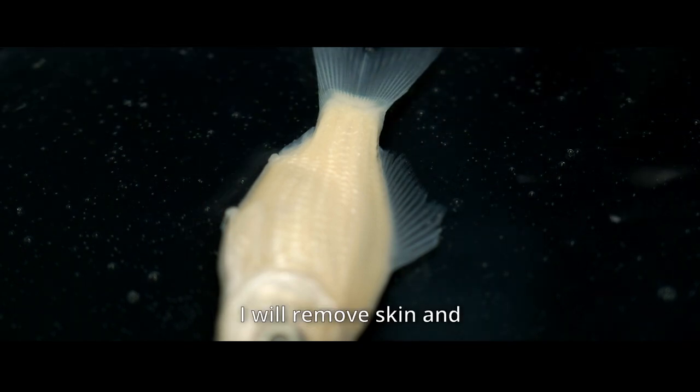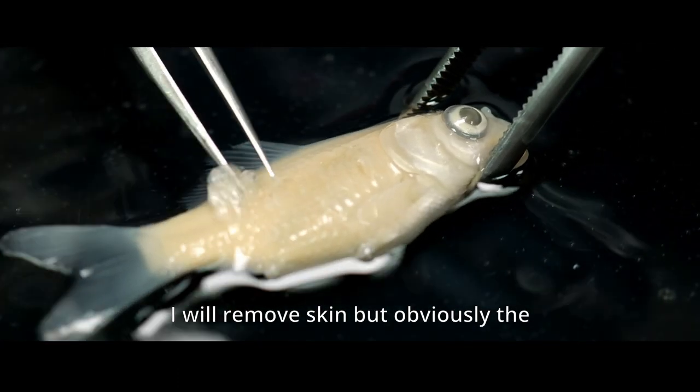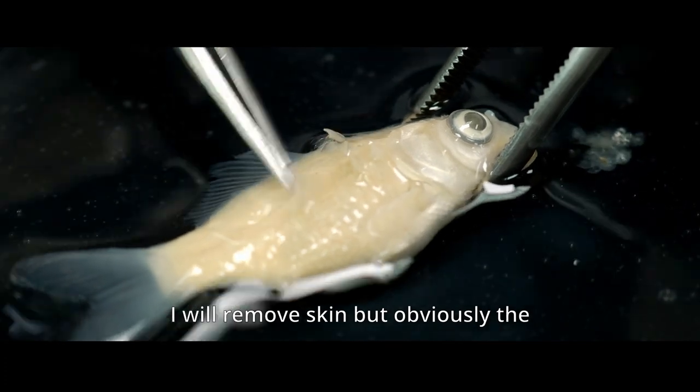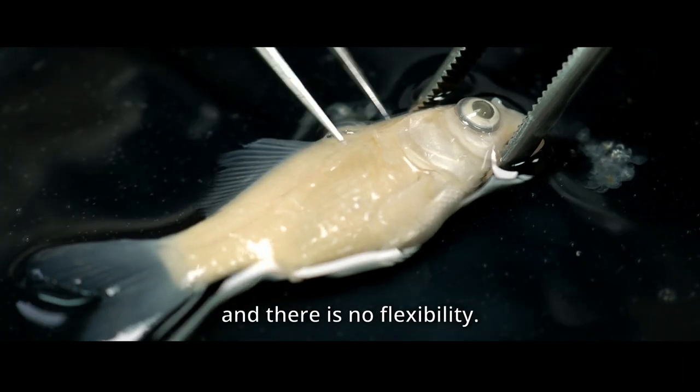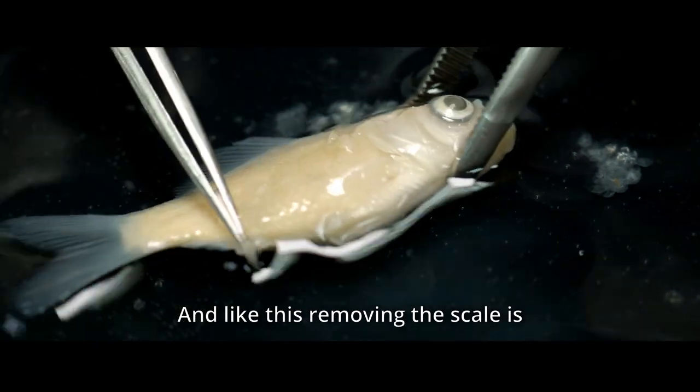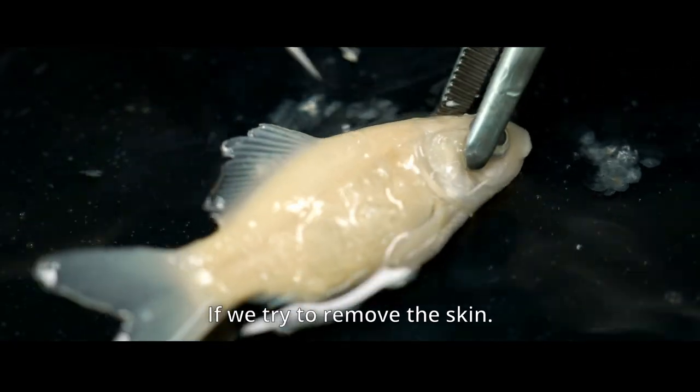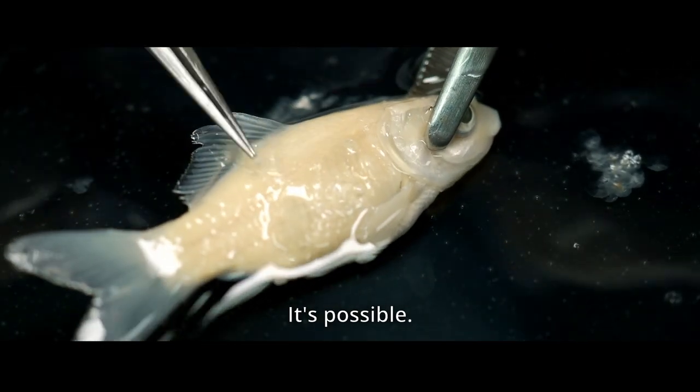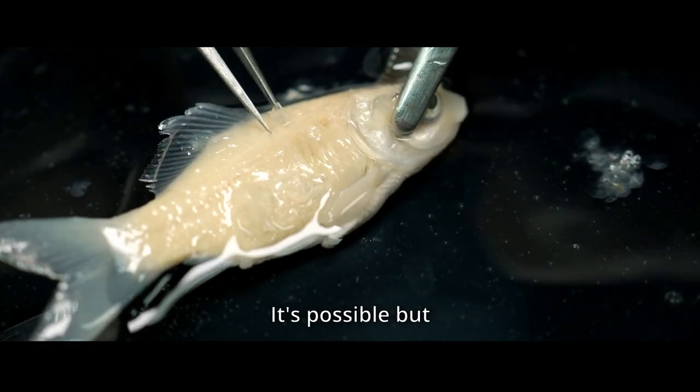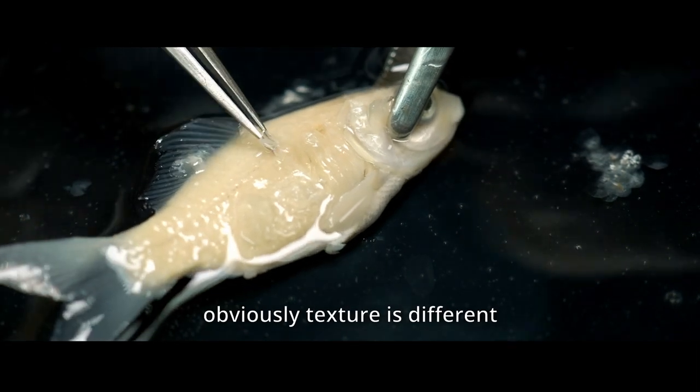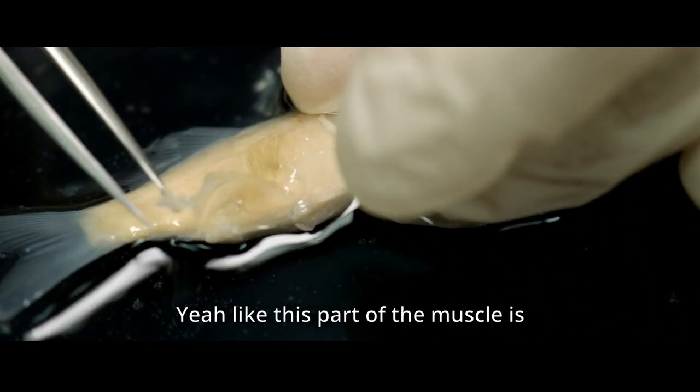Okay, I will remove skin and scale and the skin. Like this, I will remove skin. But obviously, the tissue is fragile and sticky, and there is no flexibility. Then, like this. Removing the scale is, yeah, something like this. Okay, I will try to remove the skin. It's possible, but obviously, the texture is different, and the hardness tends to increase.